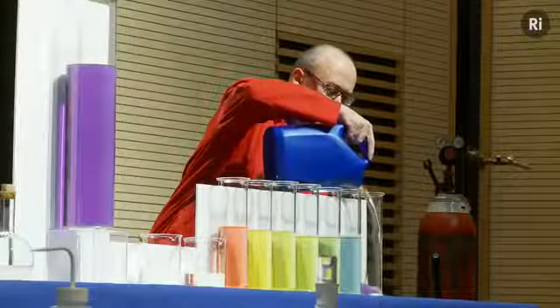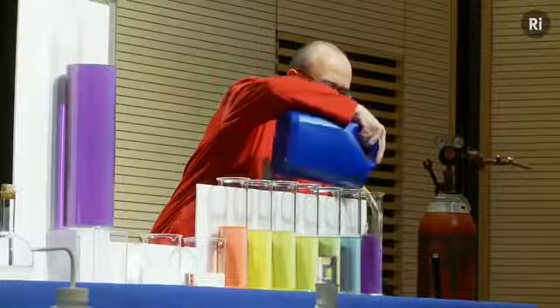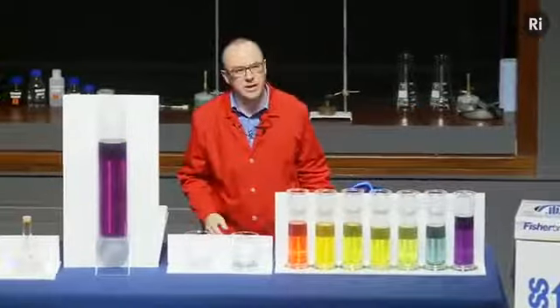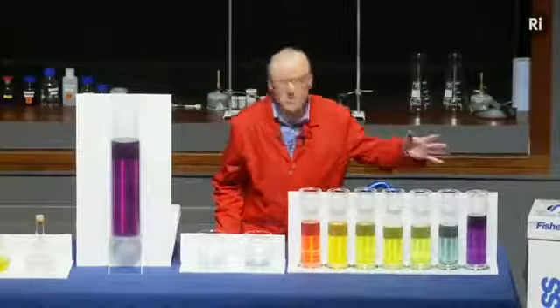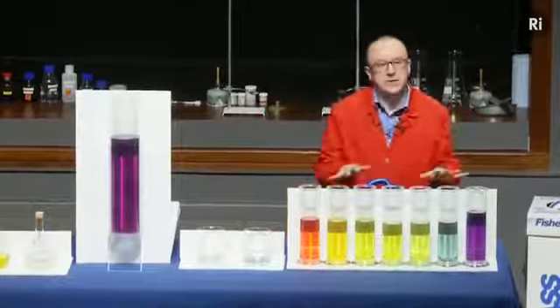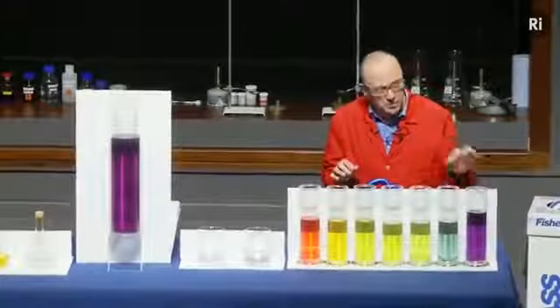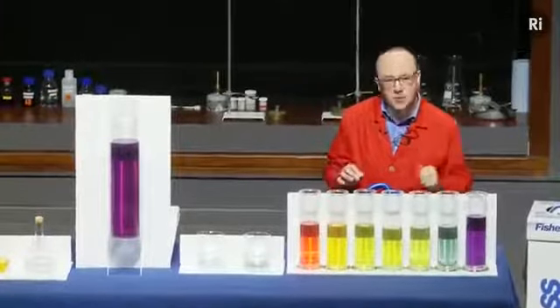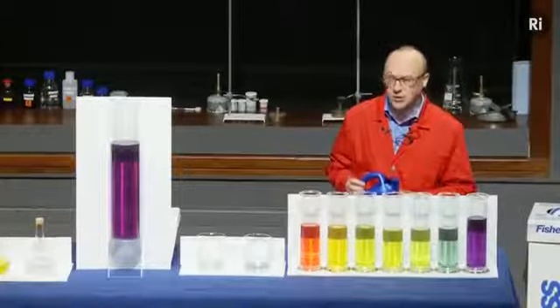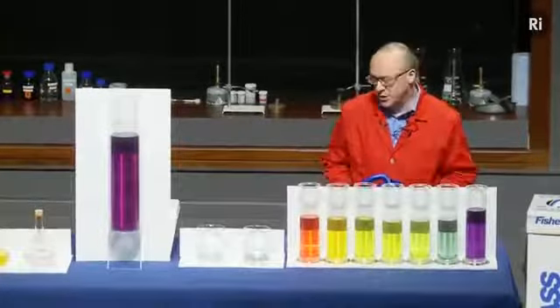In the dictionary, the word curious is defined to mean something which is puzzling or surprising or unexpected. And this demonstration might seem rather puzzling at first until we realised that the cylinders were not empty at the start. Each of them had a little speck of chemical which reacted with the liquid in this container, and it produced a colour change. We'll look at the chemistry of that in just a moment.